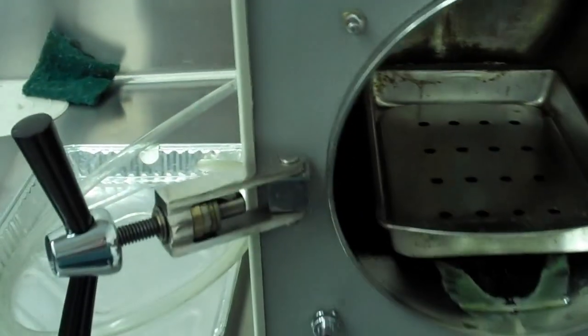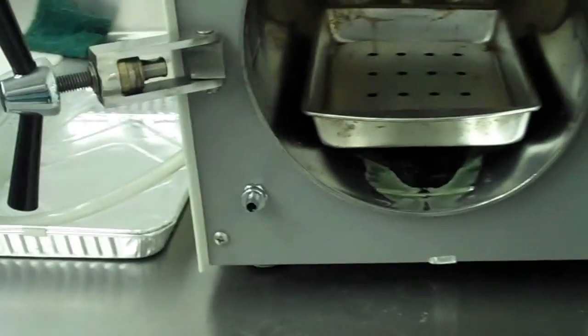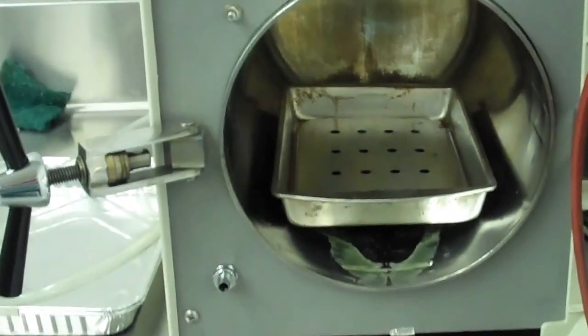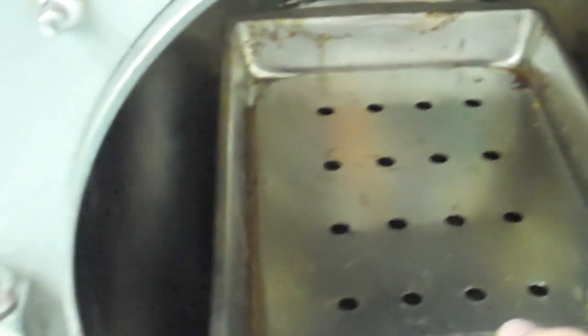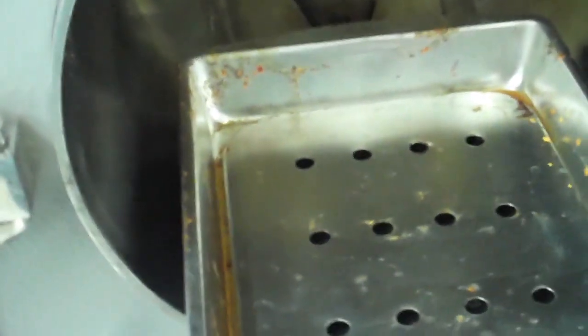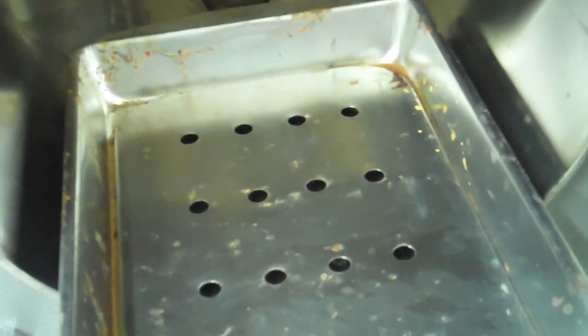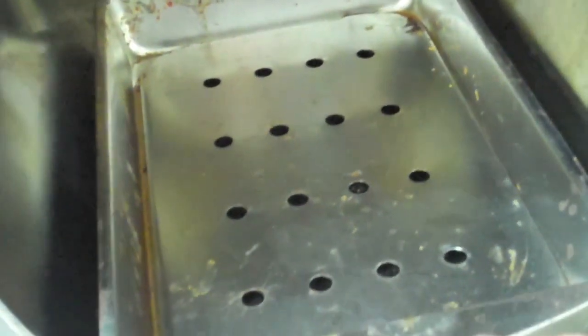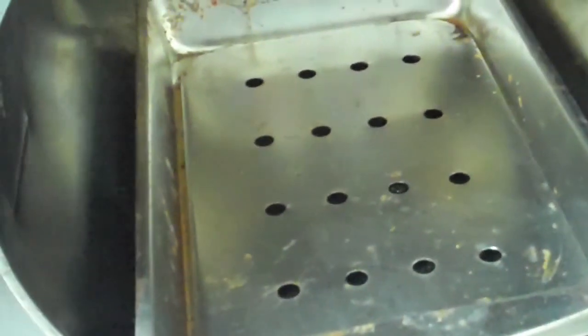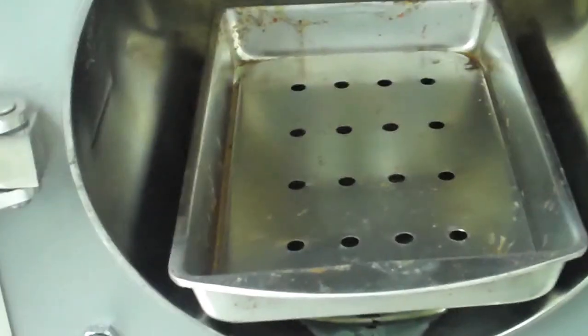Next is inside the chamber. When we place things in the chamber, we're going to place them in a tray. This tray looks like it has a perforated bottom, but the bottom of the tray is a capture tray. You must always use a capture tray so that the gel and media doesn't get pulled into the water of the autoclave.